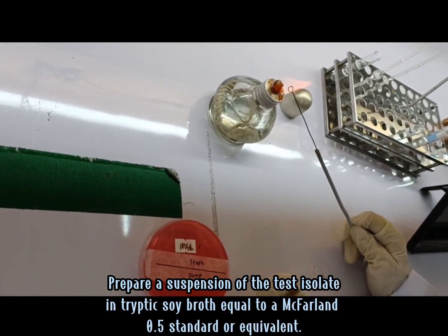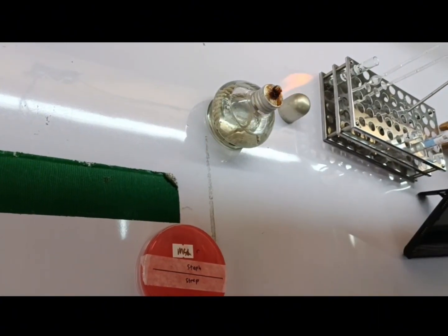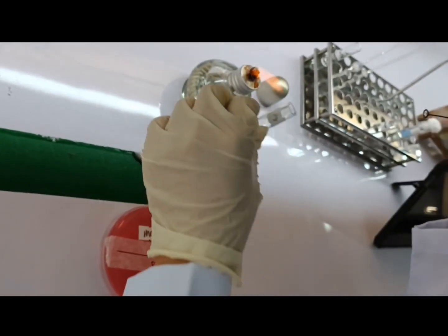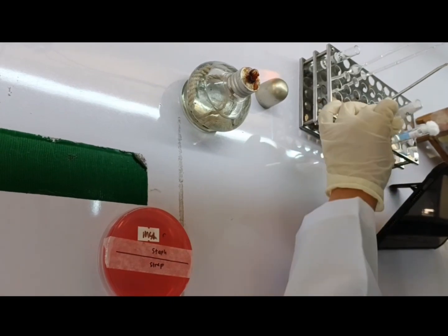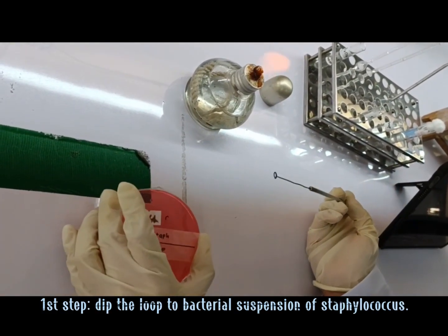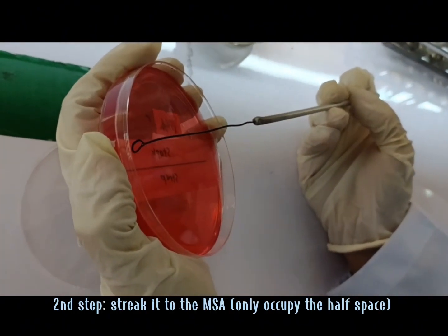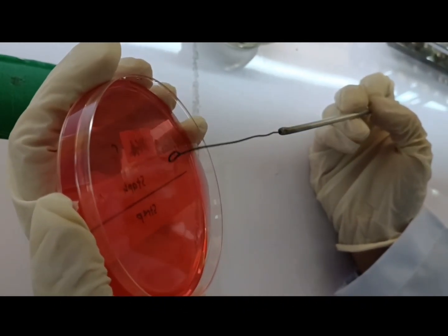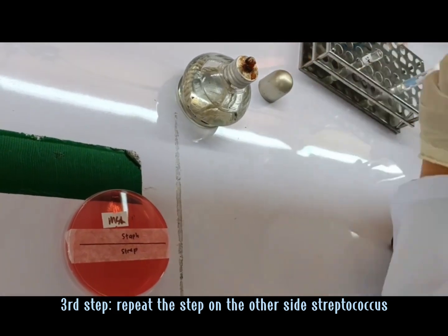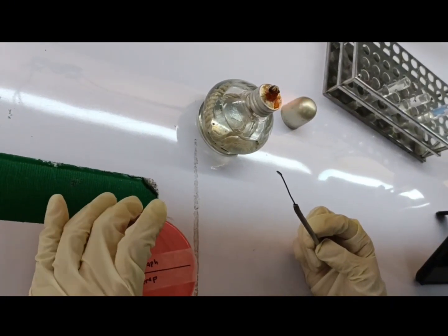We will also use a bacterial suspension for both Staphylococcus and Streptococcus. To distinguish which organism is able to ferment mannitol, we will make a line in the middle to separate the Staphylococcus from the Streptococcus, and then using a loop, dip it into the bacterial suspension of the Staphylococcus and make a streak on the MSA. On the other half of the MSA, we will do the same using the suspension for Streptococcus. We will just repeat the process.